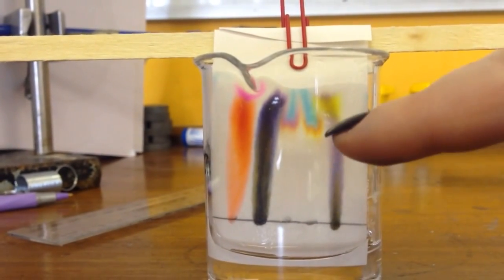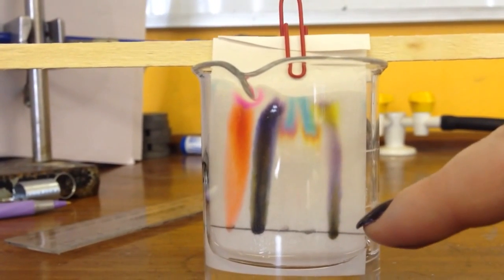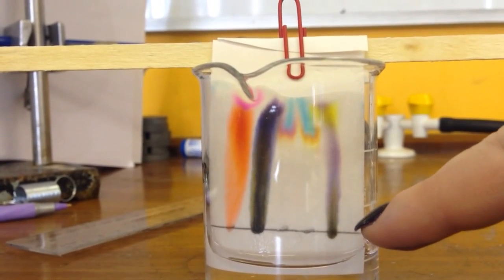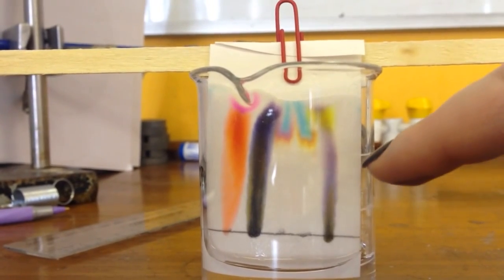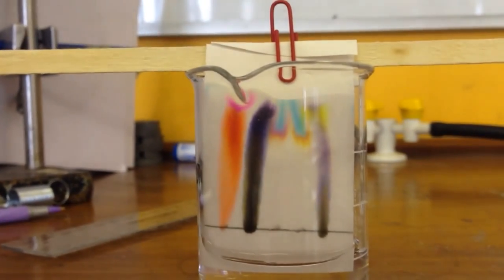The two felt tips, the brown and the grey, they're kind of mainly blue with some nice hues at the bottom here. And then the dark brown pen, it starts off black and then moves up through purple and yellow. It's really quite a nice experiment to do.